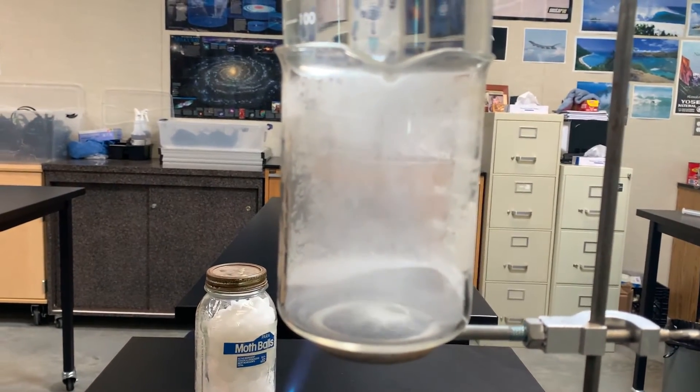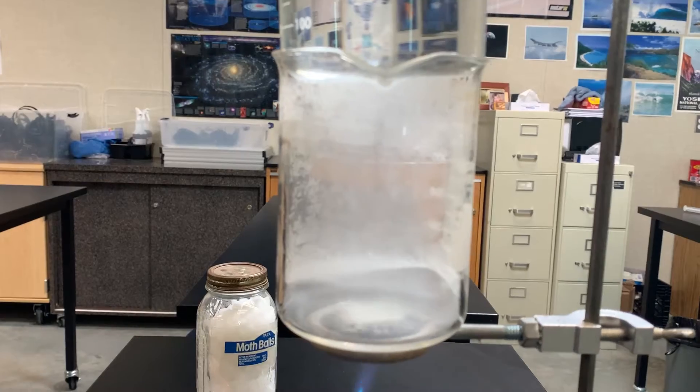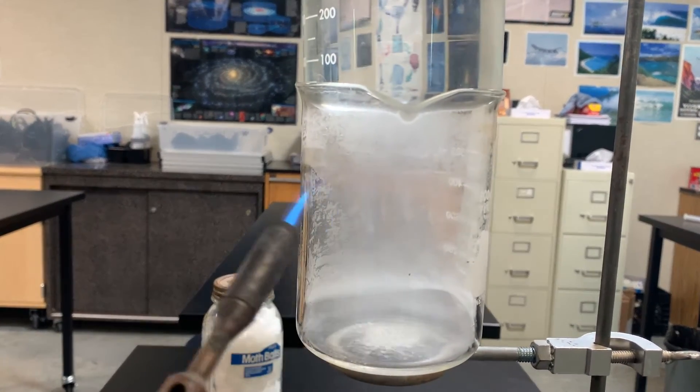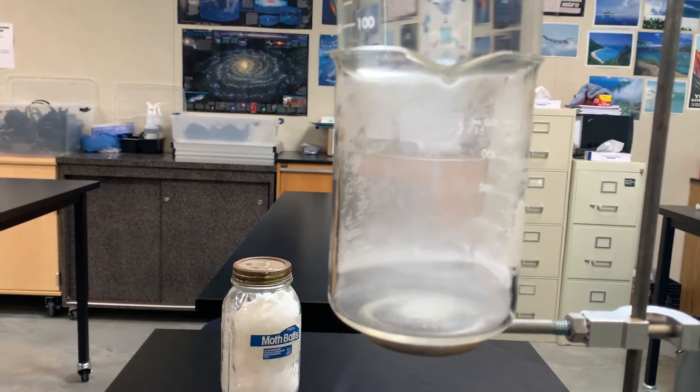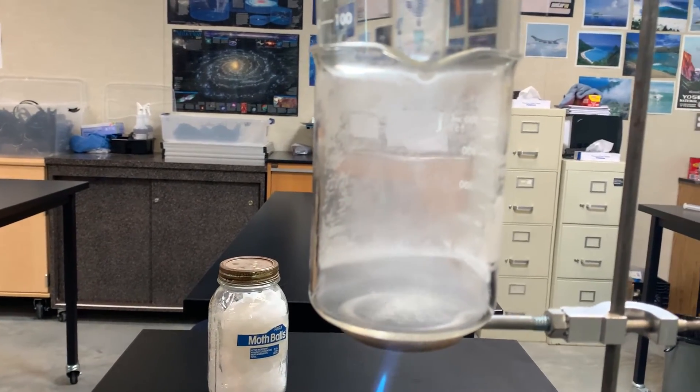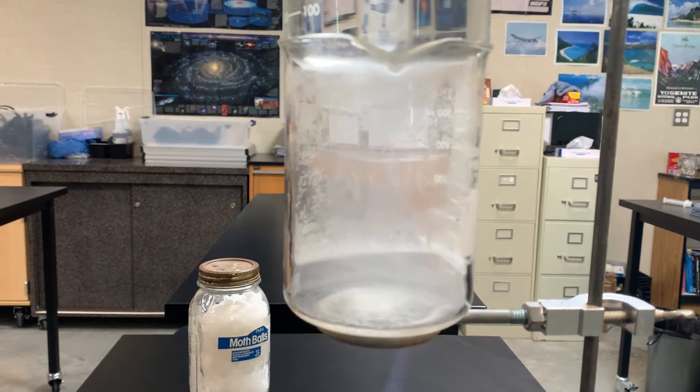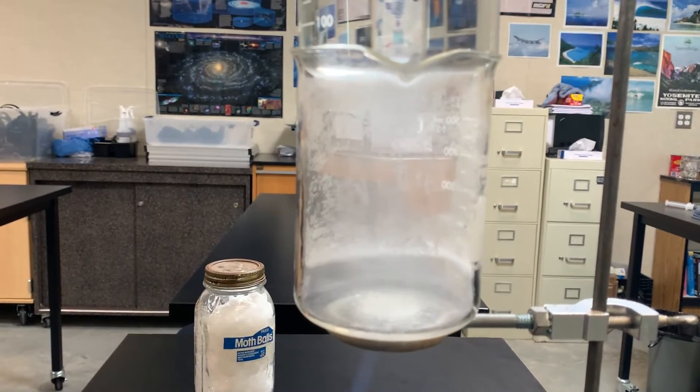And it's still filling with gas. I need to keep doing this for a little bit. It's definitely boiling. The fumes are all from that chemical. I can see some of the fumes are coming out.